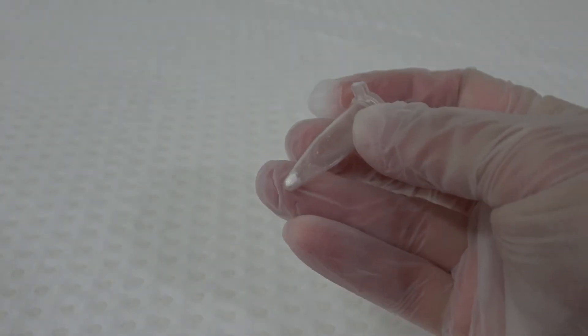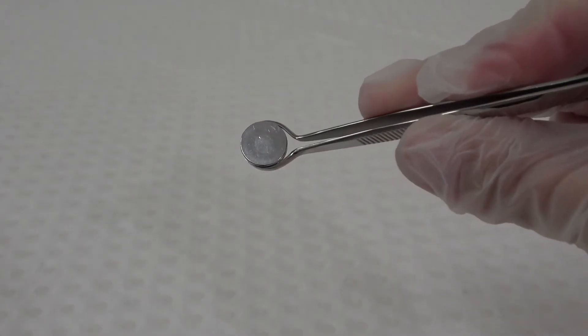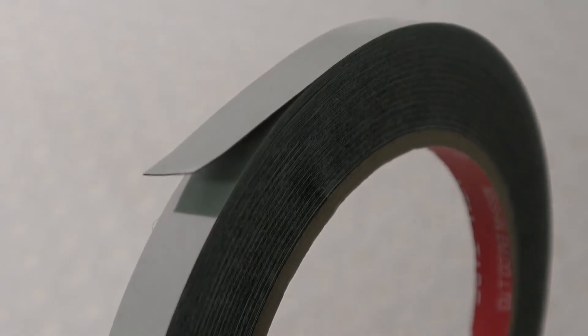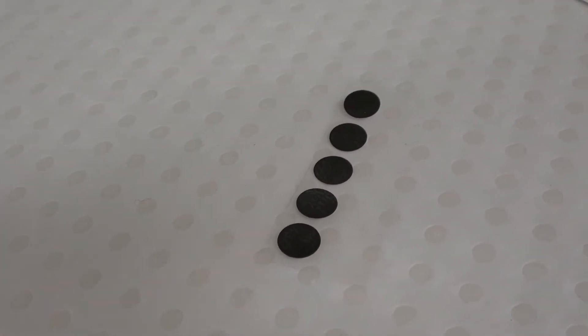Materials. A very small amount of the powdered sample. A tenth of a gram is more than enough. A small SEM stub. Double-sided adhesive. At the EMU we provide users with double-sided conductive carbon dots.